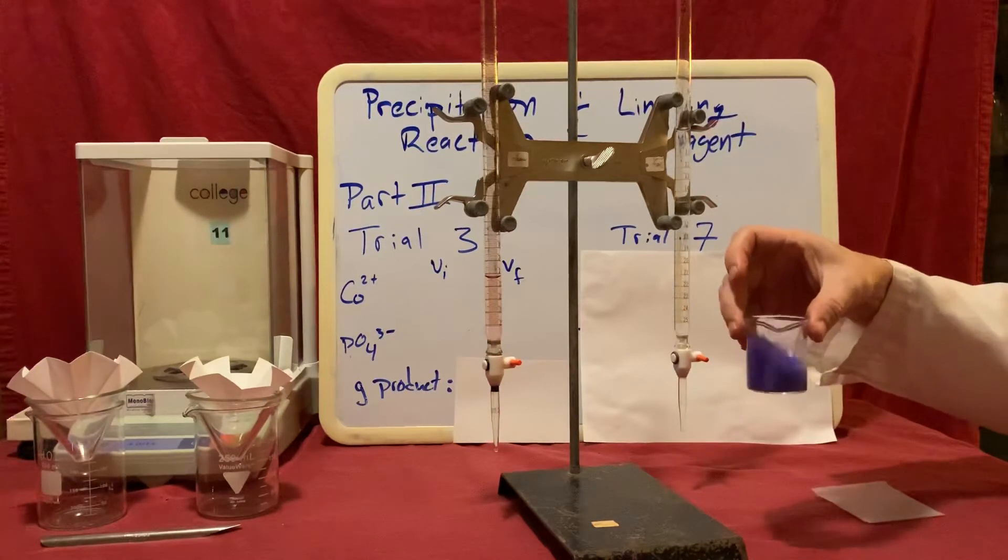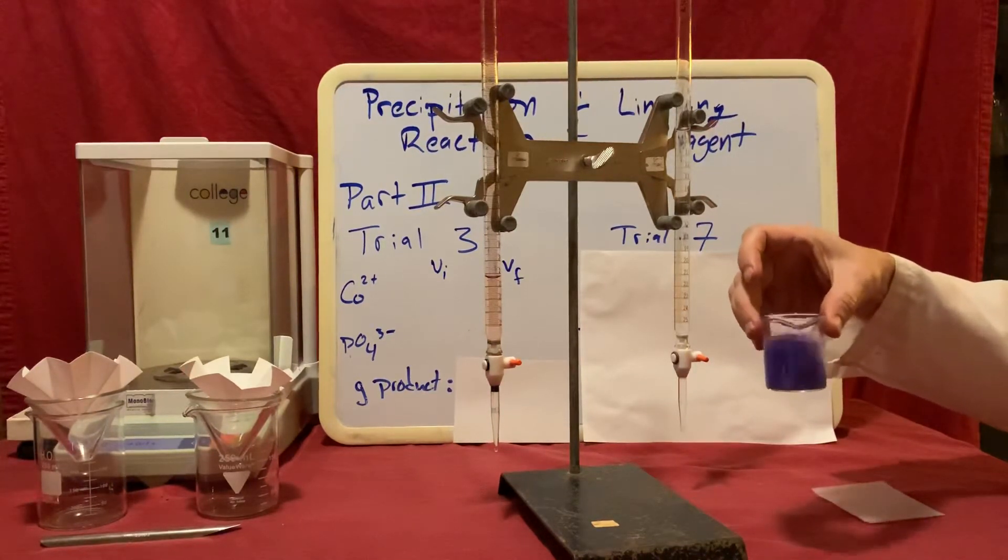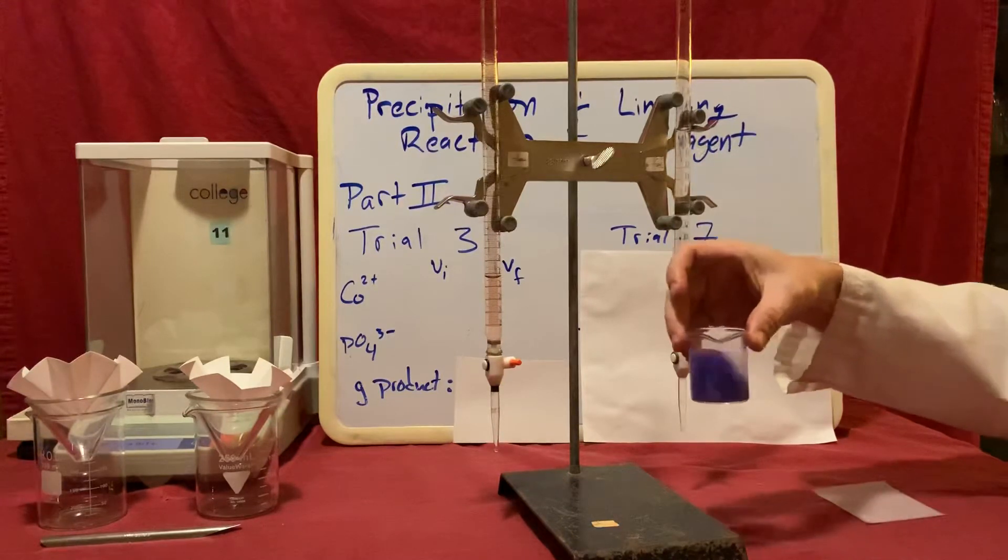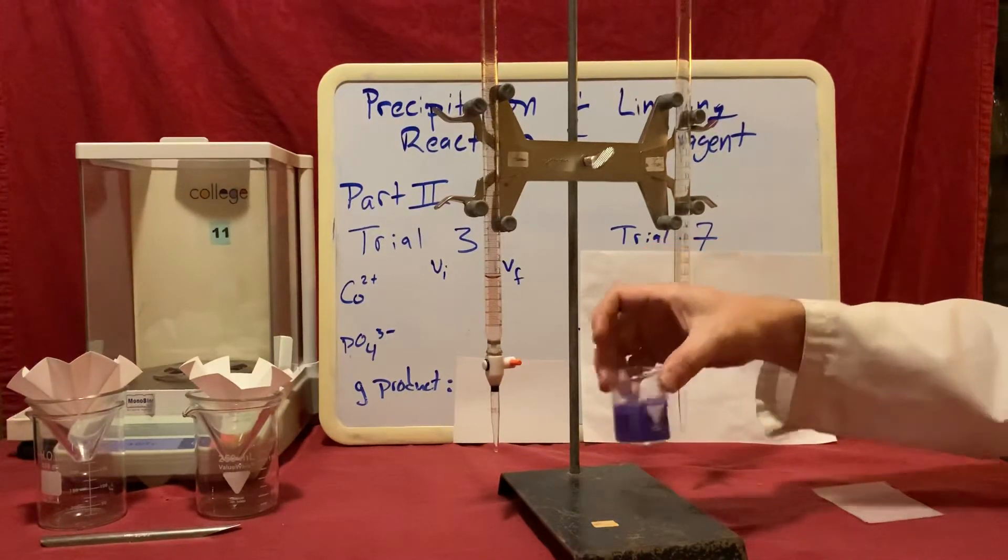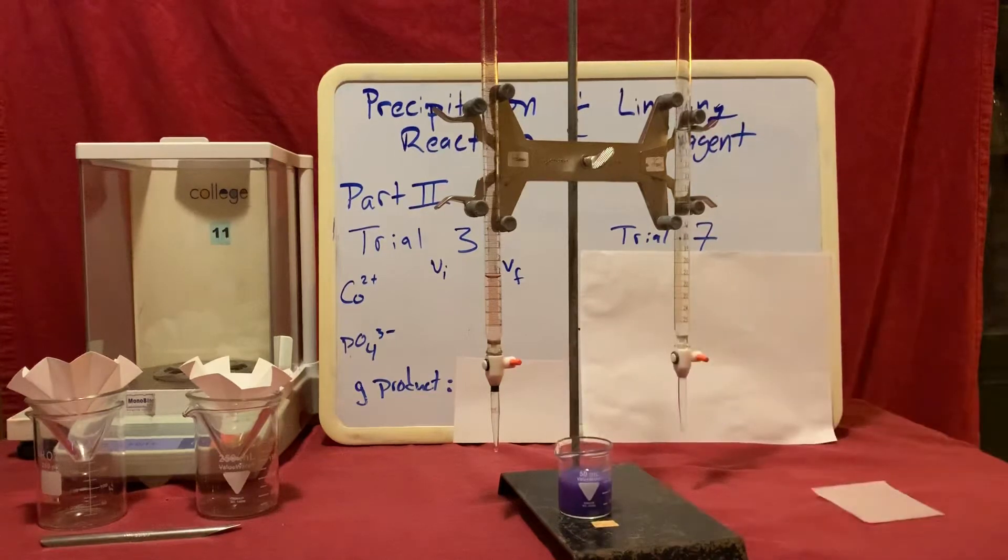I'm going to give this a good swirl, make sure it's all mixed up. We can use a glass stirring rod in order to do that. And then we want to let that react for at least 10 minutes.